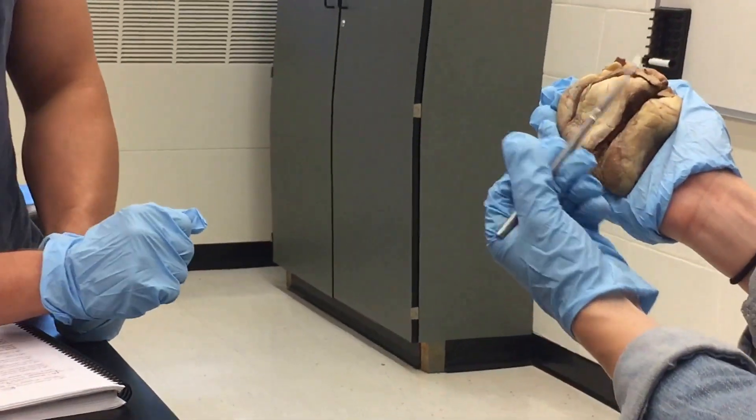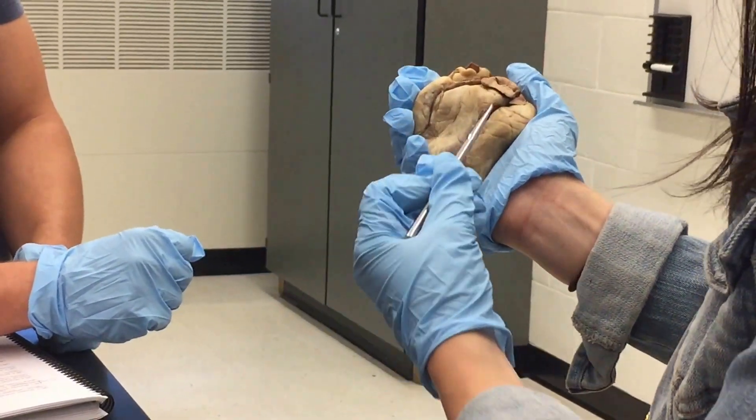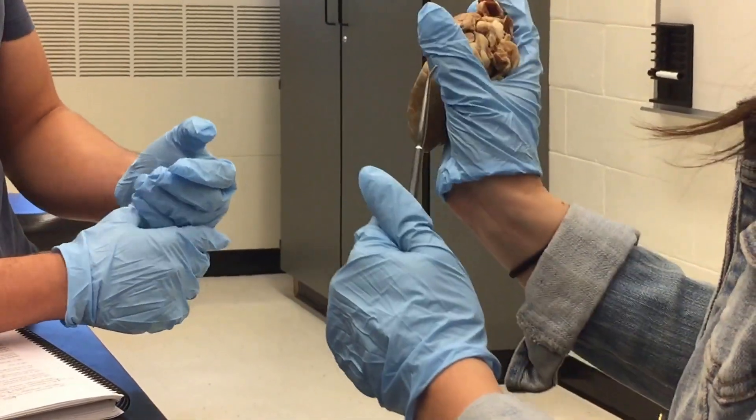This is the orientation where the heart is split. These split marks don't have anything to do with where the left or right sides start — it's just so that you can see other parts of the heart. So don't think that this divides the heart.